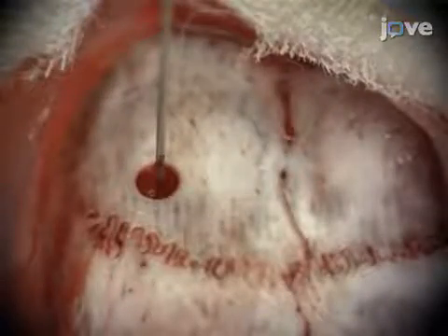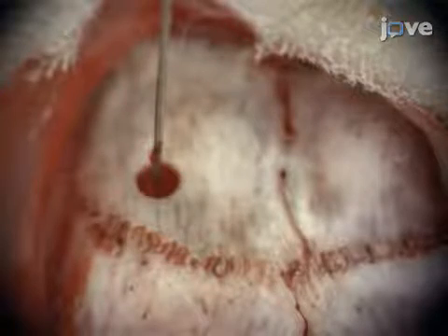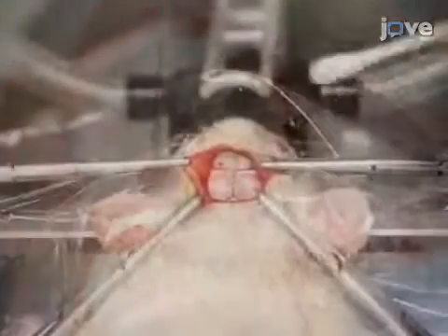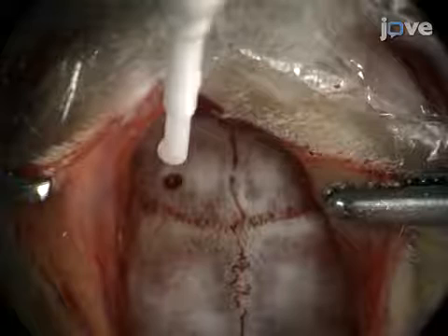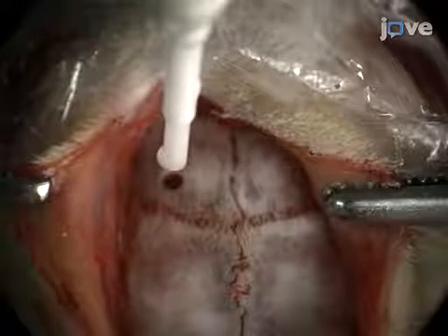After the injection is complete, wait 10 minutes, then slowly remove the syringe at a rate of 0.5 mm per minute. After the injection, dry the surface of the skull. Confirm coordinates for the ROI and insert the ferrule implant to the target depth at a rate of 0.5 mm per minute.